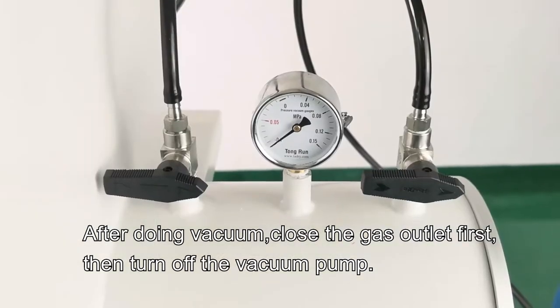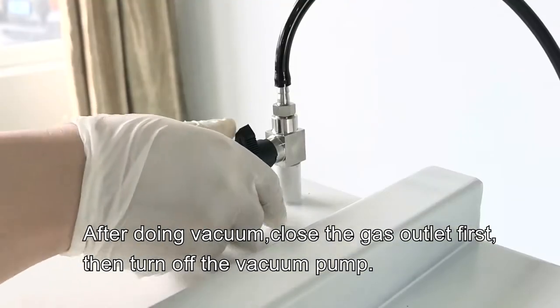After doing vacuum, close the gas outlet first. Then turn off the vacuum pump.